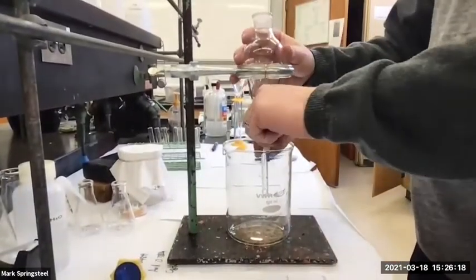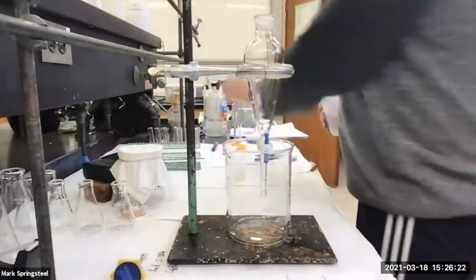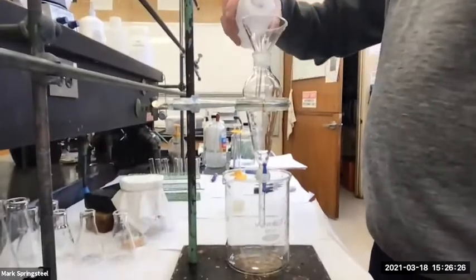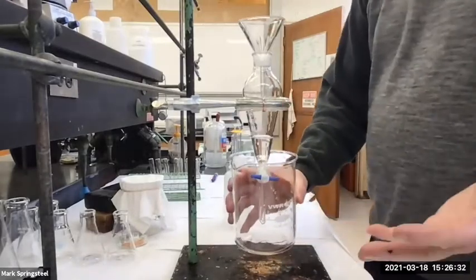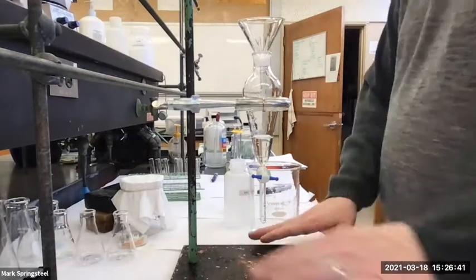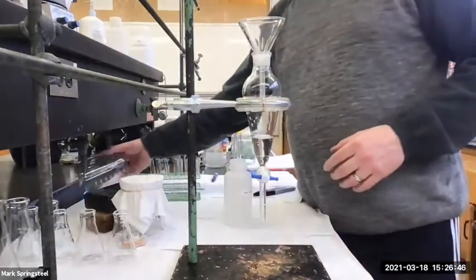So if I do happen to fill this up, like say I'm gonna go, oh yeah, let me get my organic layer. I'm gonna add this to my separatory funnel. Let me start pouring it in. And then I realize, oh no, it's spilling. I forgot to close it. It's in the beaker, it's no problem. If I don't have the beaker there, then the stuff just spills all over the counter. And that's happened a lot. And we don't want that to happen because it's a hassle.